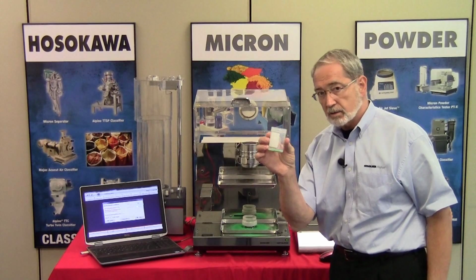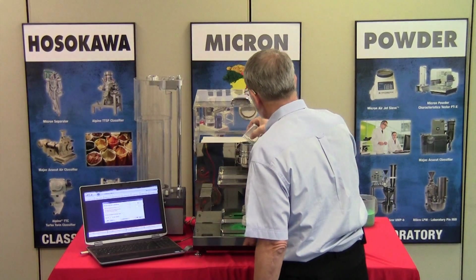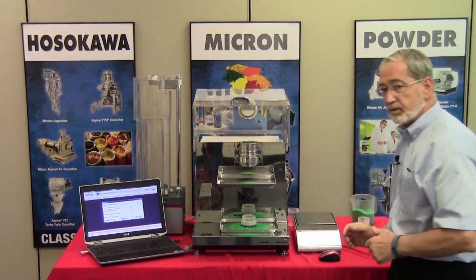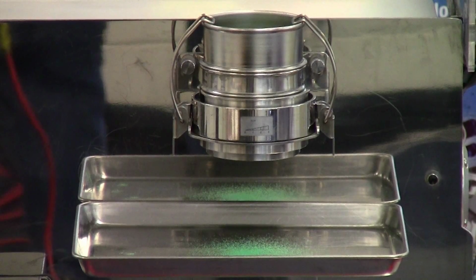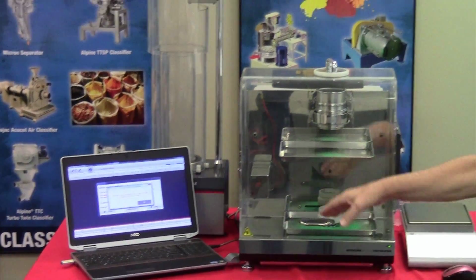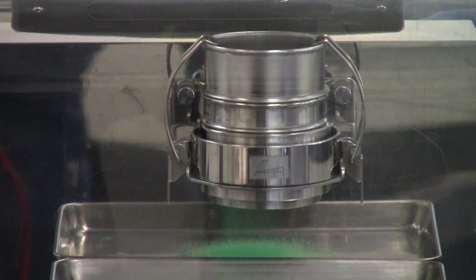The software has a minor little step in there that's missing. It didn't tell you to charge the material. So what we're going to do is we're going to put the material in. And notice already that some of the material is passed through. I don't know if you can get a close-up on it, but if you can, that's great. So we're going to press start. We've always got to be closing, for safety purposes, the cover. And now what will happen is the vibration will begin.